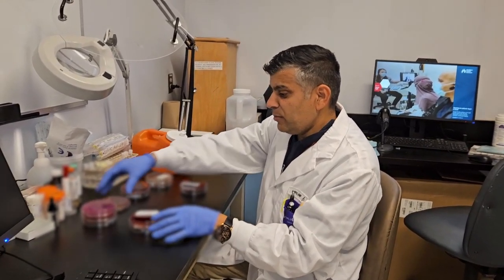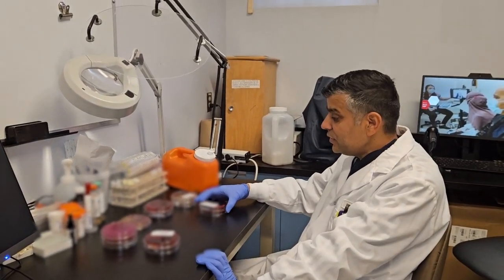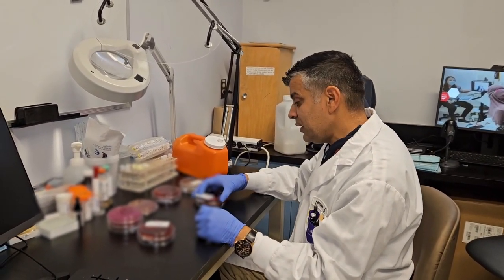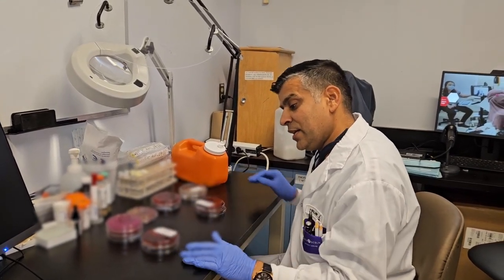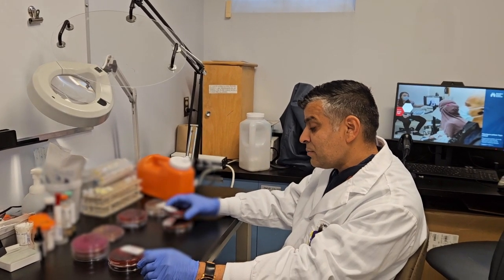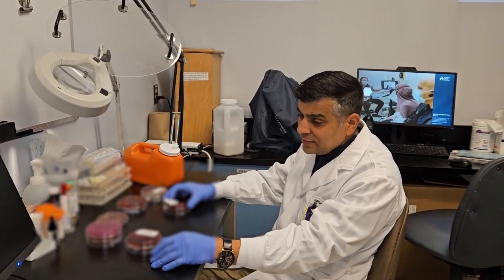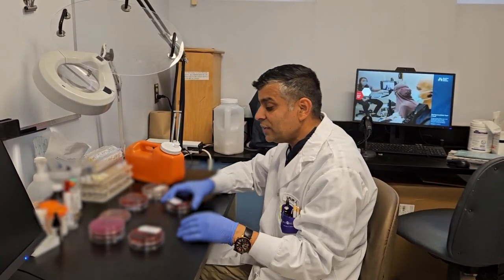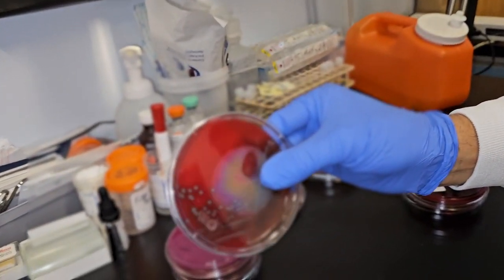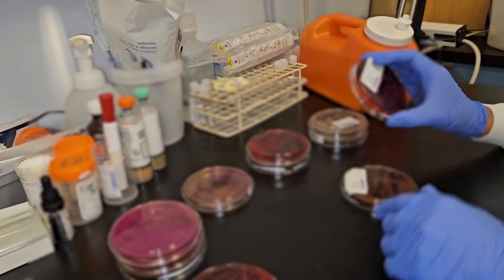Now I'm going to show how bacteria look on solid agar plates. To begin, let me show you some of the agar. Broadly, these agar media can be classified in many different ways. A very popular one is based on their performance. They could be non-selective, which allows the growth of all bacteria. For example, the blood agar plate, which is non-selective agar, and it also has a slightly differential function.